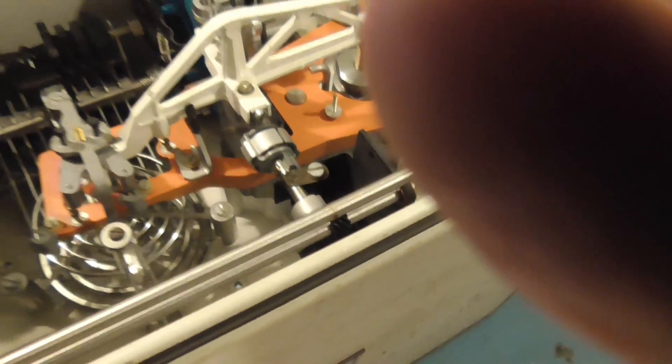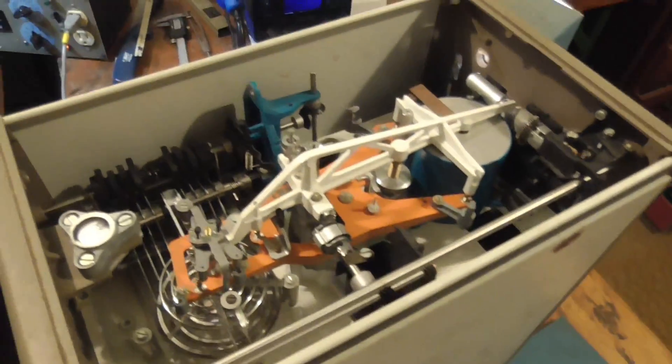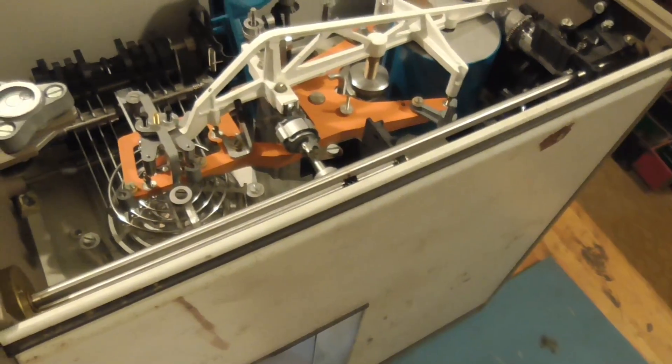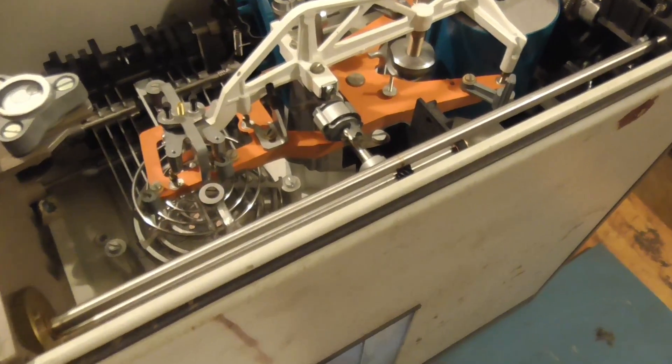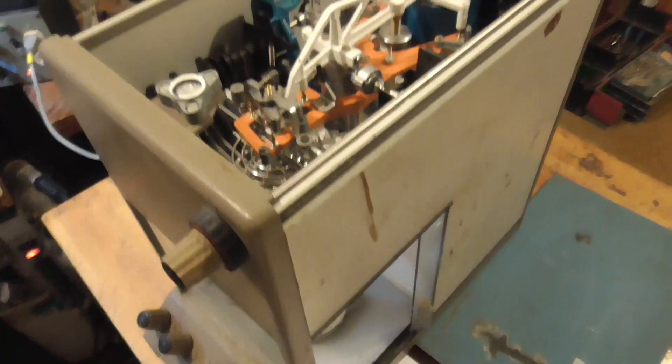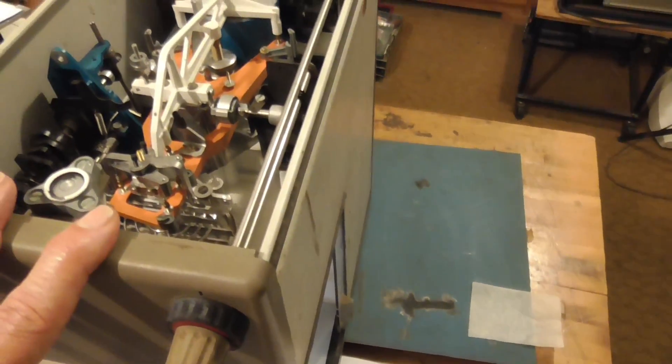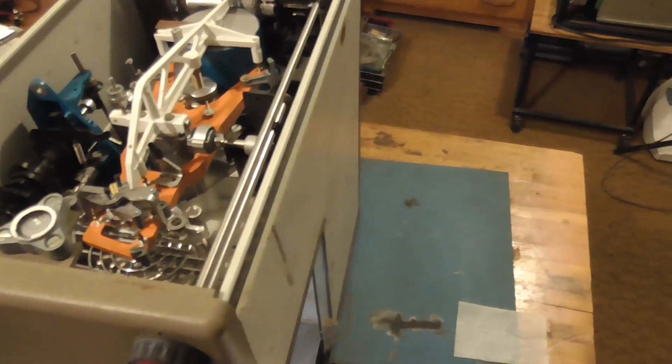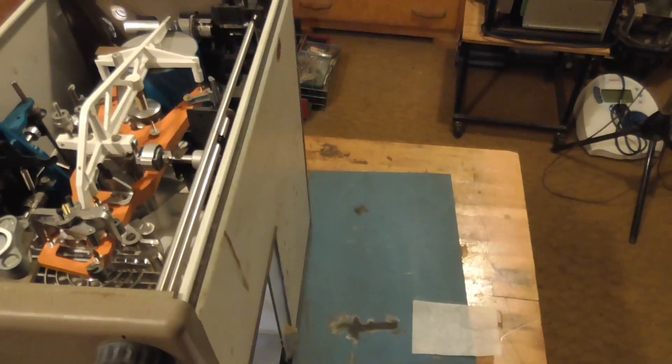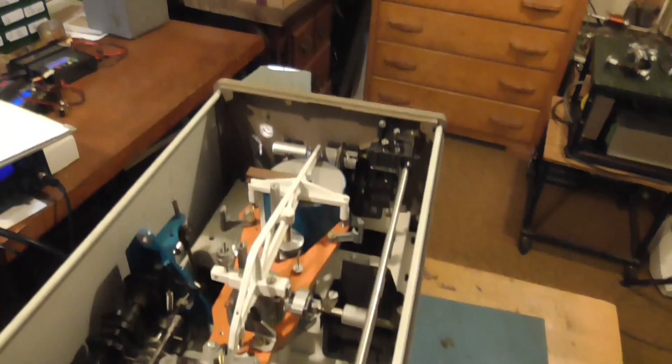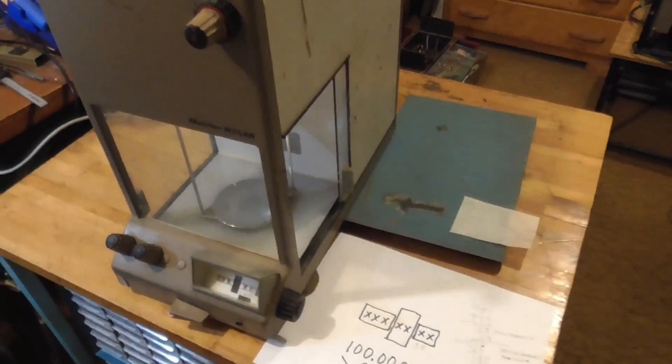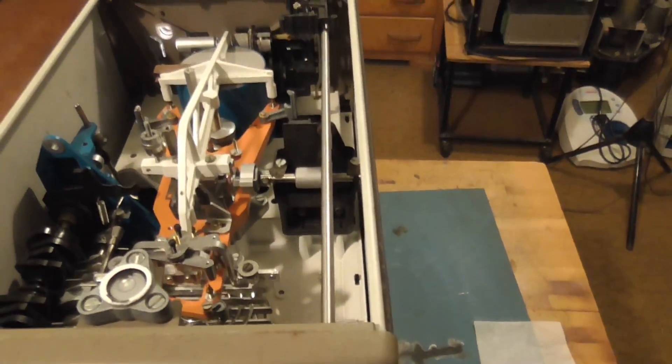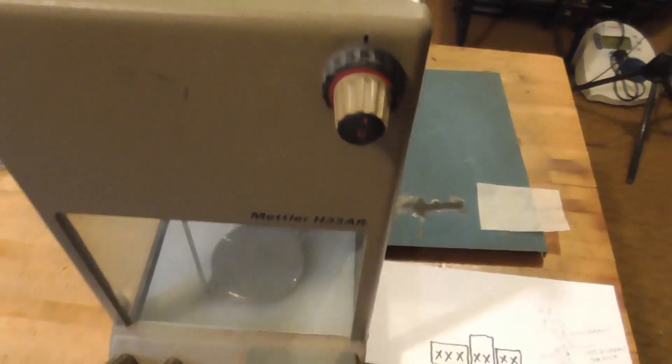There is no manual for it. You cannot go online and find a manual for it. Toledo, who makes these things, said this thing is so old that they don't even have record of the manual in their computer system. This was before they had computers, so the manuals never got scanned or anything like that. So even getting a copy of the manual for this thing is impossible. And if you got the manual, then you'd have to sit there and learn all that stuff and figure out how to do it.